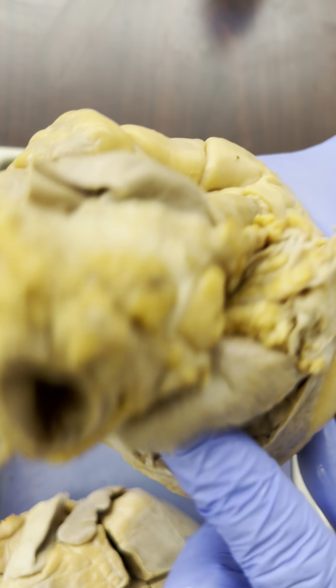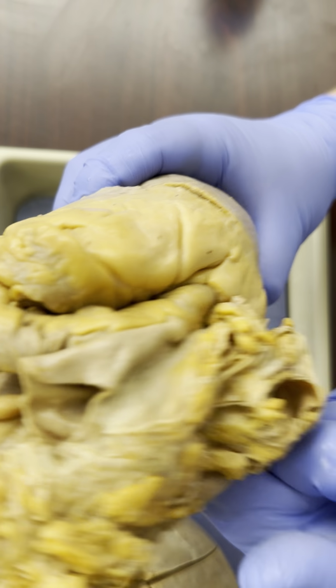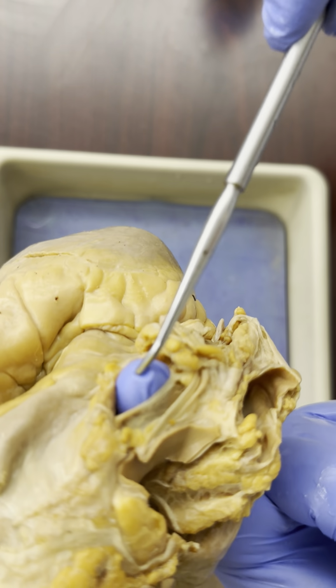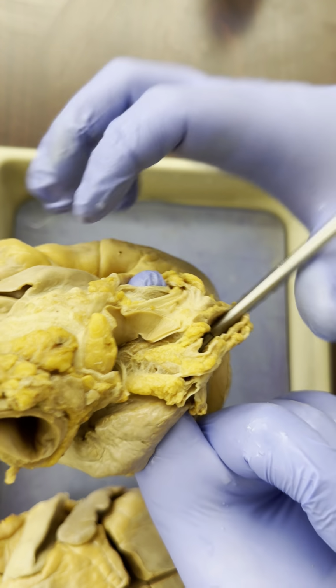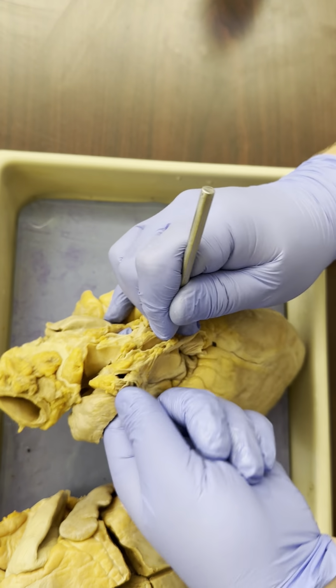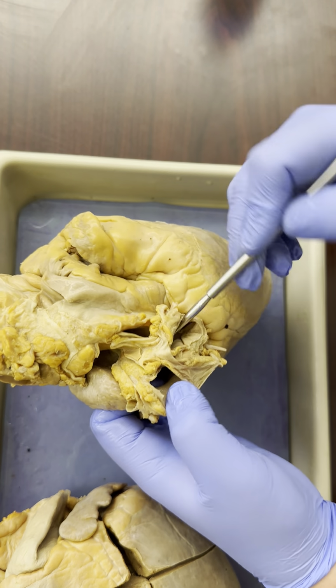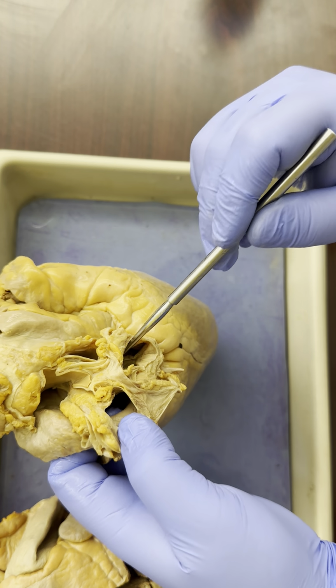Now go over to the left atrium, stick my fingers through, see where all they come out. There's one fingertip, and this probe also goes in. So I've got two things going into the left atrium. The one coming from the right side is coming from the right lung.